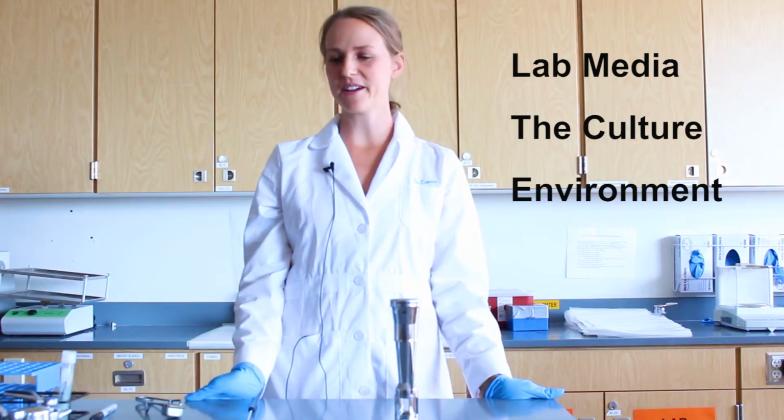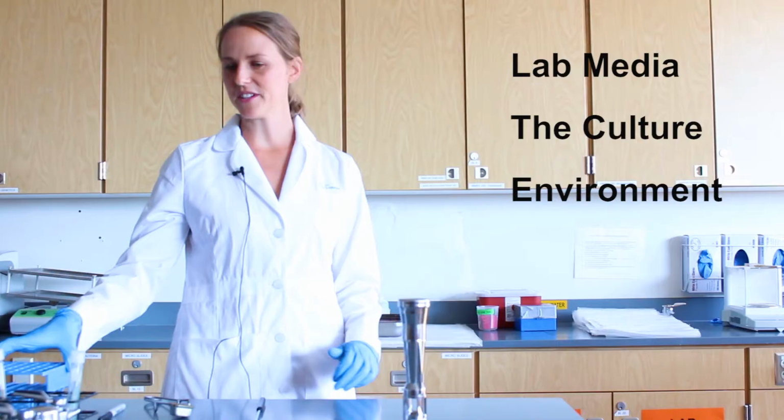In today's video, I will demonstrate how to subculture bacteria into different types of media. When performing these transfers, it is important to maintain sterile technique. This will ensure that you do not contaminate the lab media, the culture, or the environment. I will specifically show you how to make 3 different types of transfers.